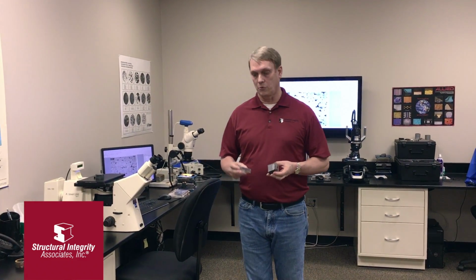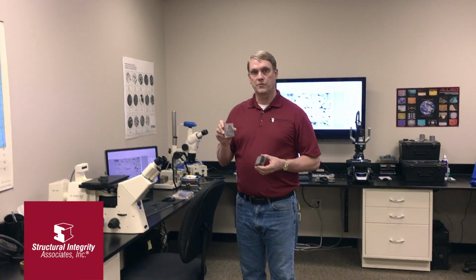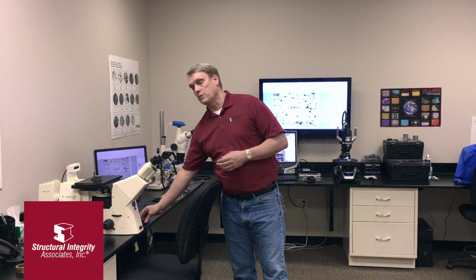Once our metallographic samples have been polished and etched, we can look at the microstructure or features of interest using the metallographic microscopes here in the microscope room. Typically we're looking at crack morphology or surface conditions. In some instances we're looking at weld microstructure and features associated with the welding process. In some samples we're looking at grain size or inclusion content. And basically we're just trying to get information metallographically that helps figure out what caused the failure.